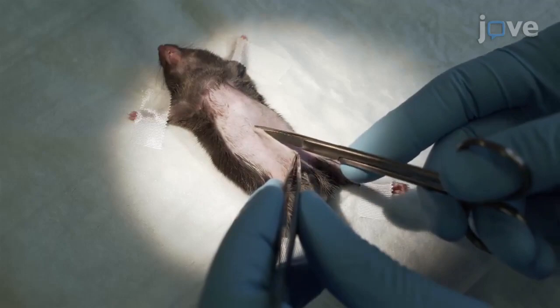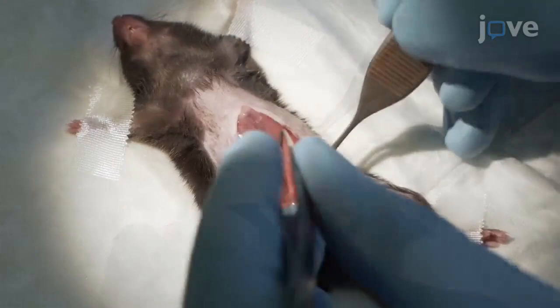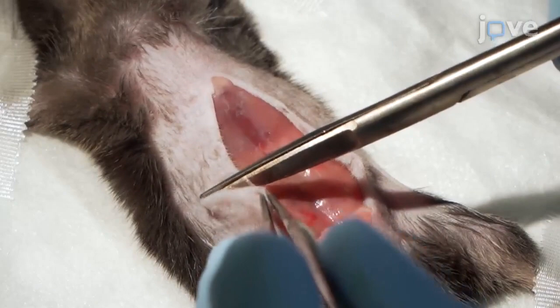Make a median cut through the skin from the pelvis to the sternum and use tweezers to remove the skin from the abdominal fascia. Cut the skin on both sides of the abdominal midline and make a median cut through the abdominal muscle layer from the bladder to the xiphoid.